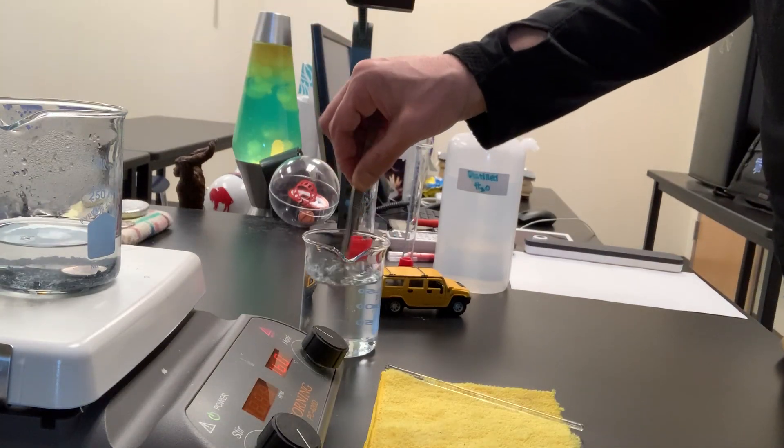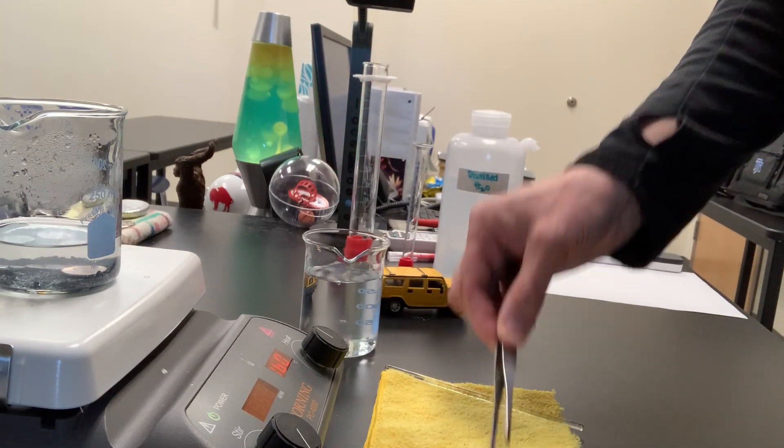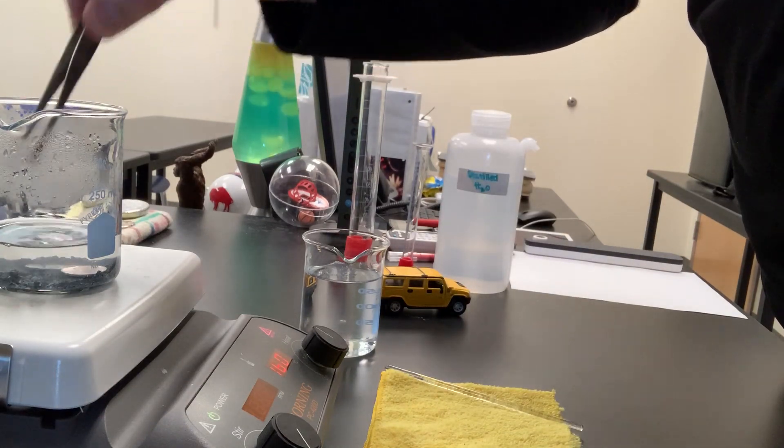We rinse them off in some distilled water. I'll place them on my cloth here just for a moment. Just be patient.